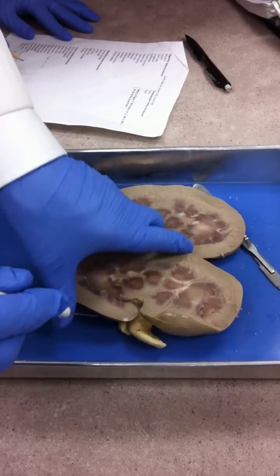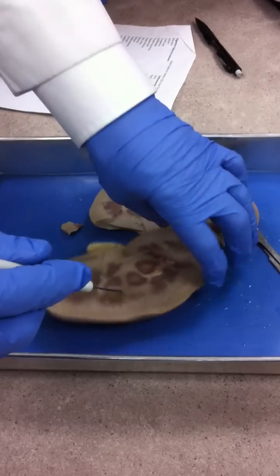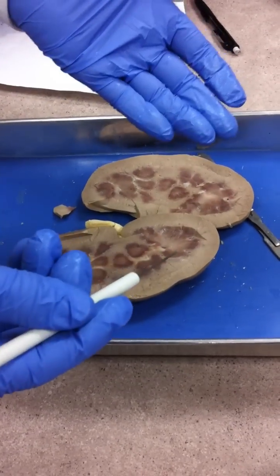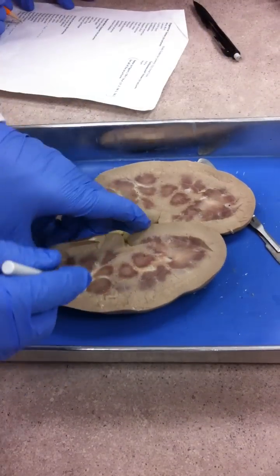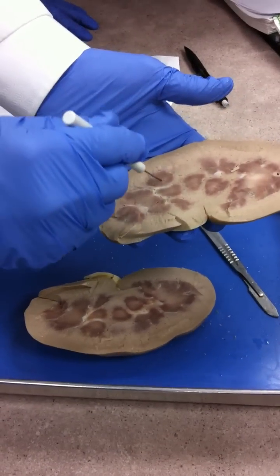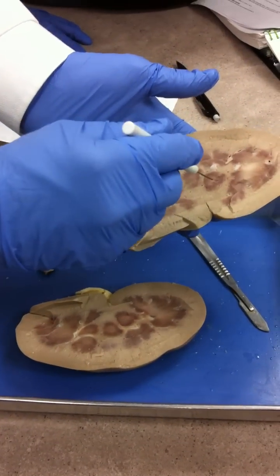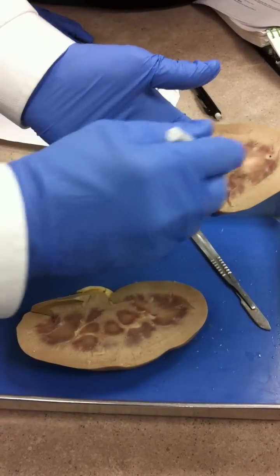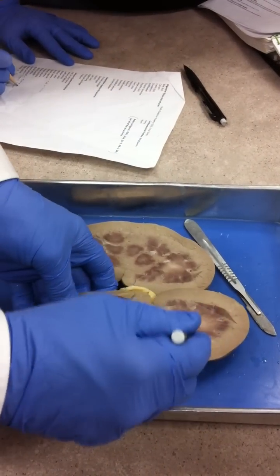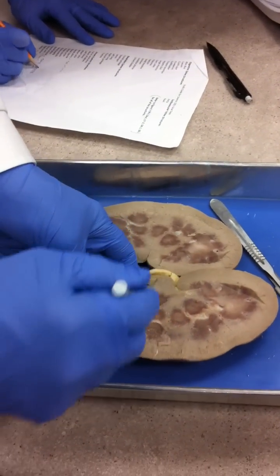Also on your list are renal pyramids. They're shaped like pyramids, like in Egypt. These things here — that's a pyramid, pyramid, pyramid. See the dark colored circles? Those are all pyramids.